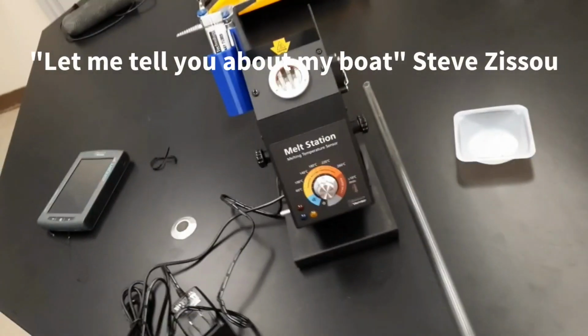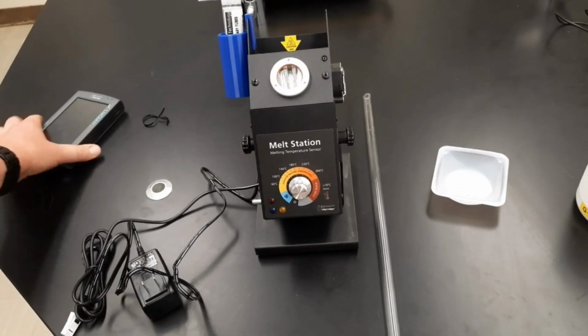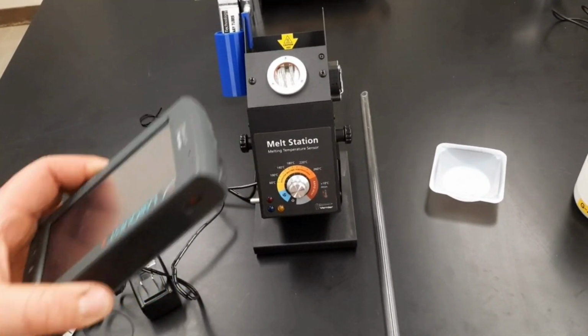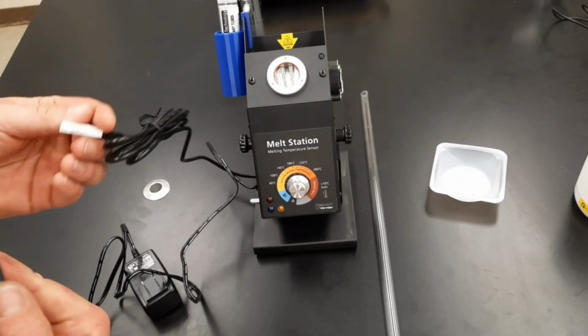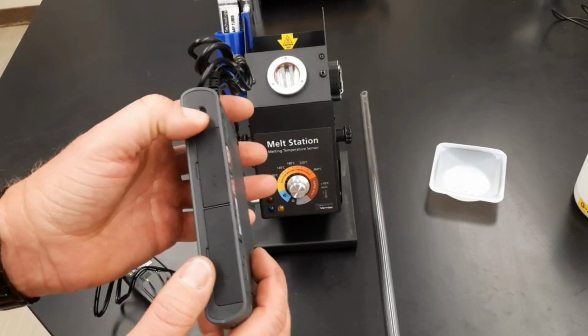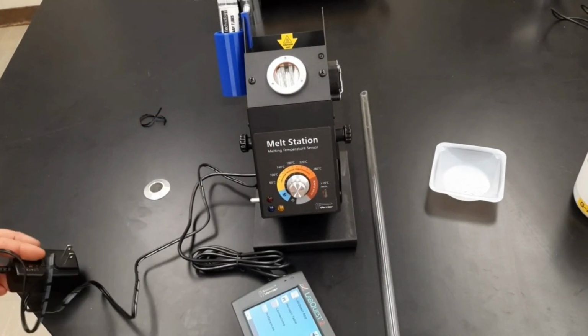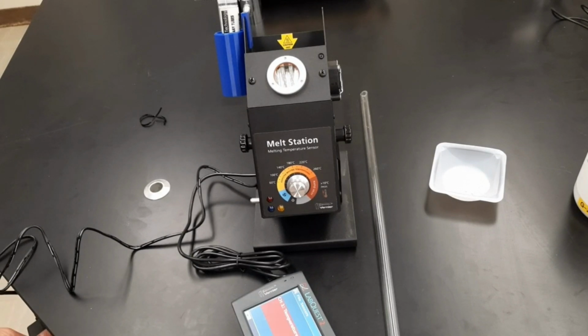First thing to do is turn it on. Now, this melt temp station actually integrates with a small digital thing called a LabQuest. So we want to make sure things are plugged in. Data cable gets plugged in. Turn this sucker on. Turn on the instrument itself is plugged in.